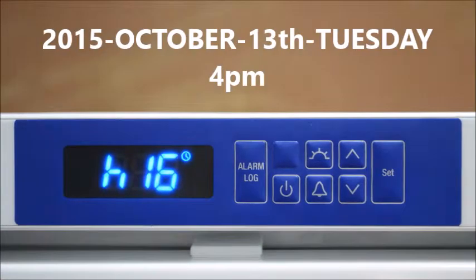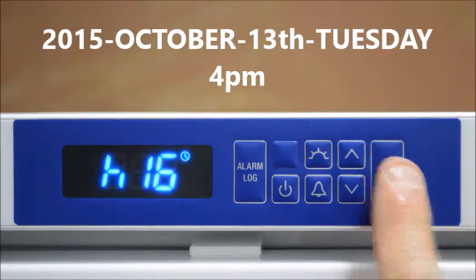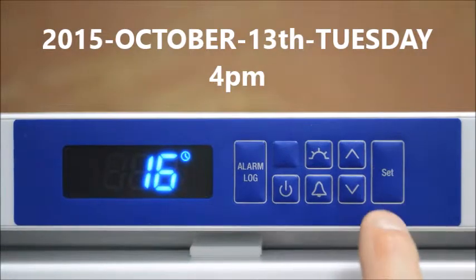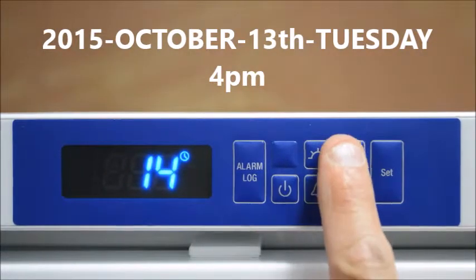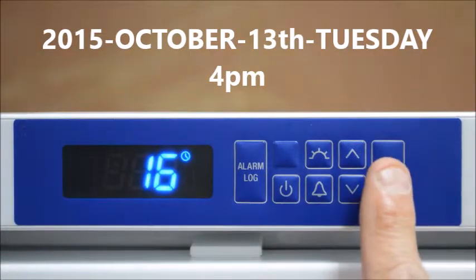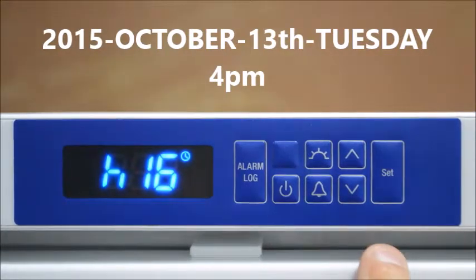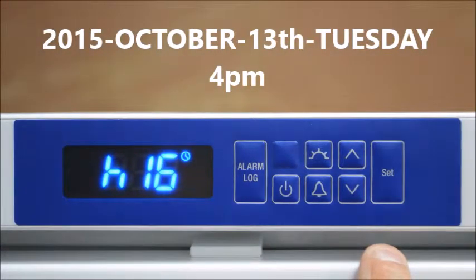By pressing the up arrow we can change the hours. Press the SET button and change the hours by scrolling up and down with the arrows, then press the SET button and the hours are locked into the memory.